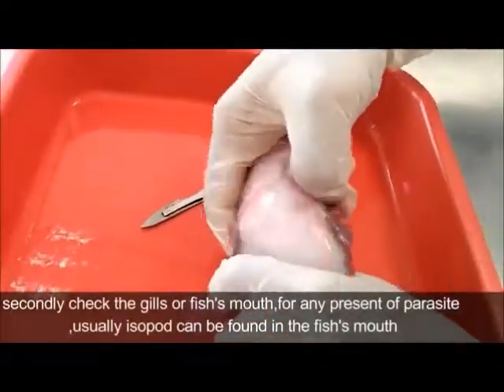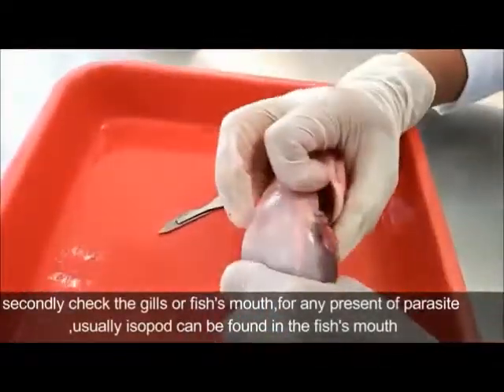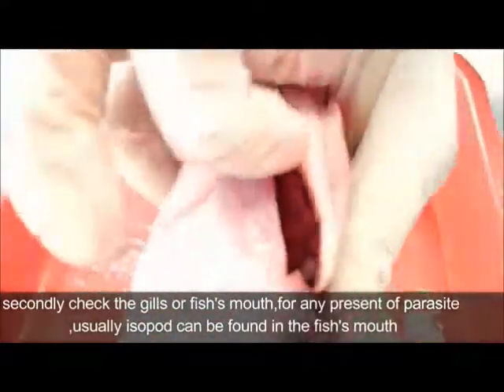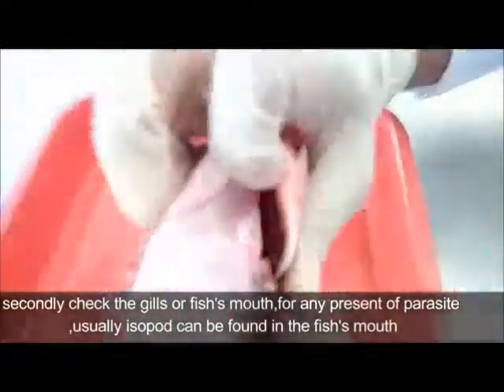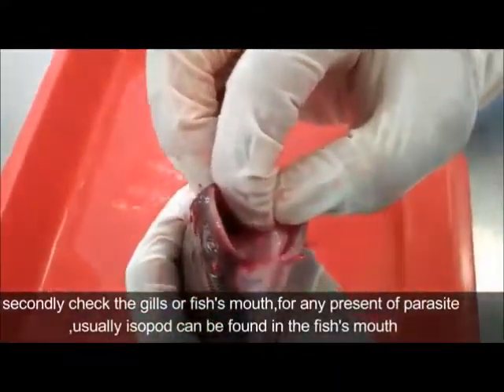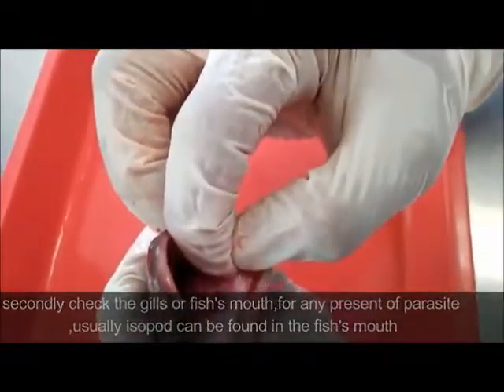Secondly, check the gills or fish mouth for any presence of parasite. Usually isopods can be found in the fish mouth.